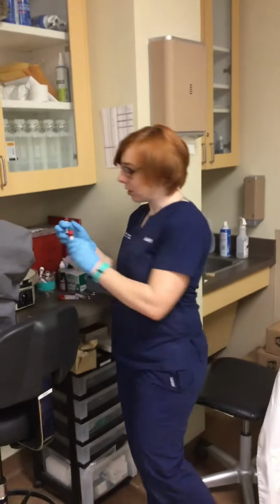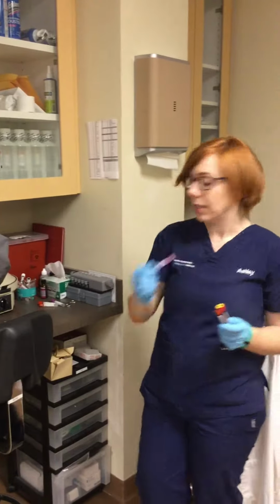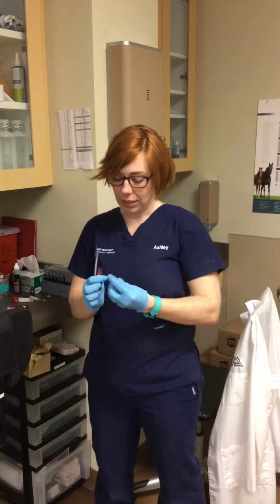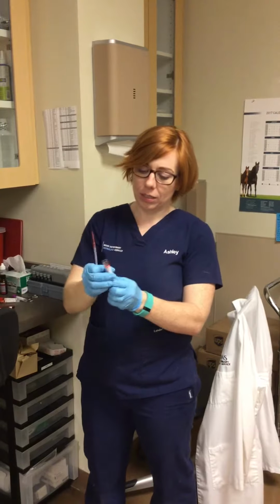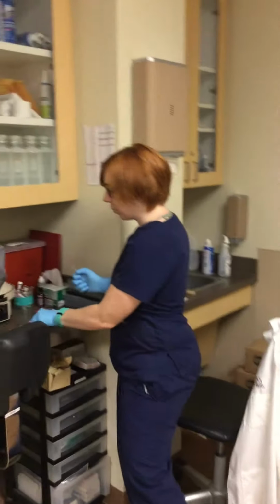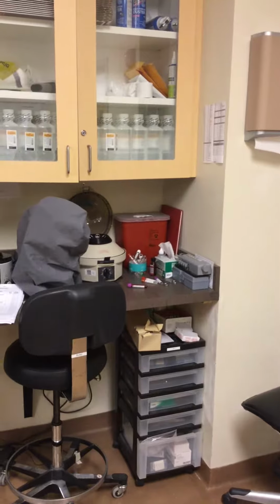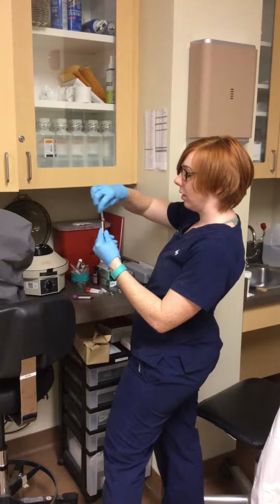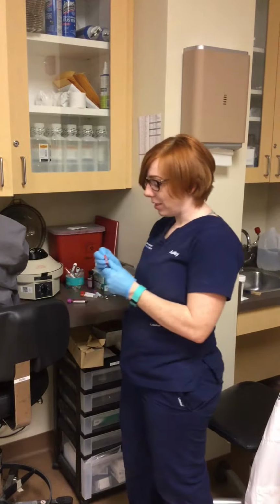I've allowed these tubes to clot for about 20 minutes so you can see that they're clotted. This one's not gonna clot because it has the EDTA in it. So I'm going to remove the top carefully and I'm going to rim the tube here, and I'm going to rim this one, but I'm going to get a different pipette so there's no contaminating. Then I'm going to put it in the centrifuge.